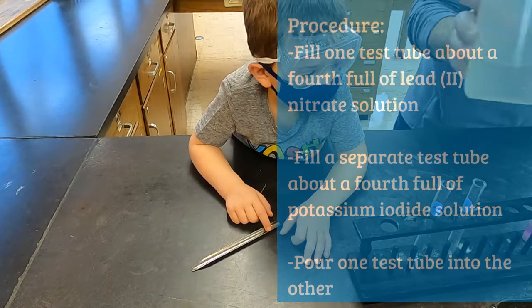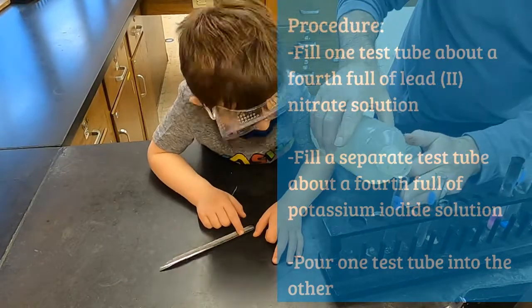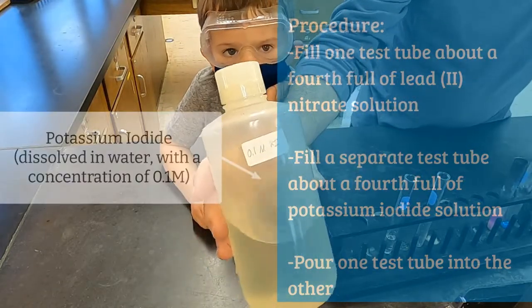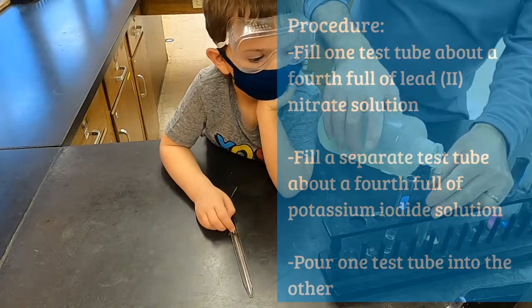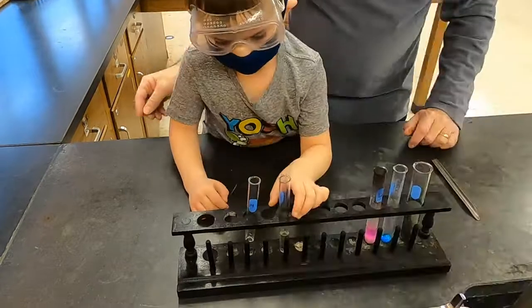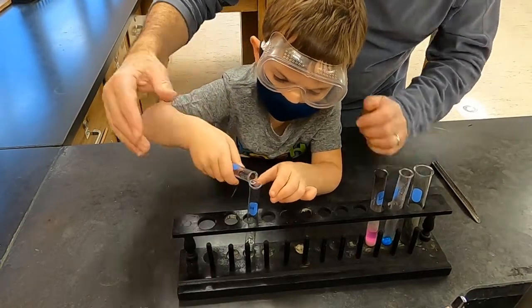This is the correct way to do this procedure. So these two bottles, that one has lead 2 nitrate and it's dissolved in water. It has a concentration of 0.1 M. This is potassium iodide. It also is dissolved in water with the same concentration of 0.1 M. All you have to do is put them into 2 separate test tubes and then mix them.